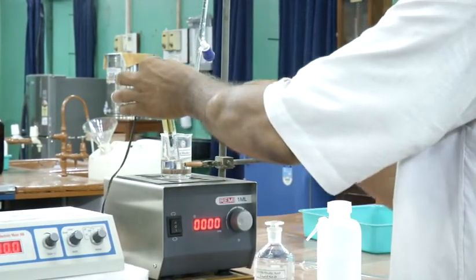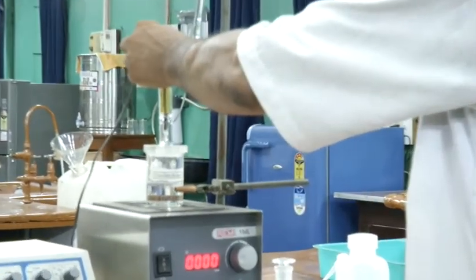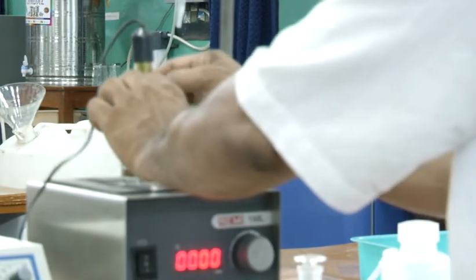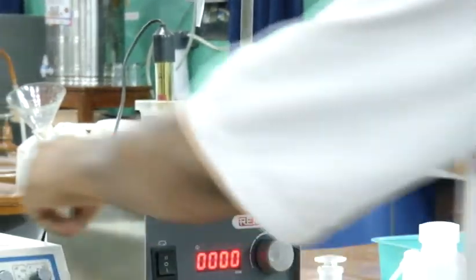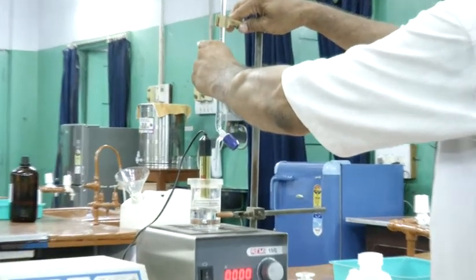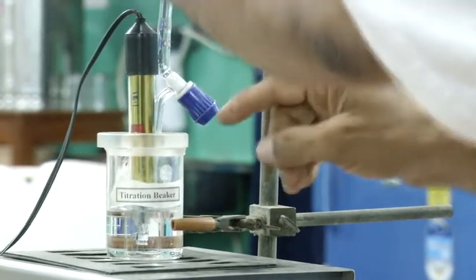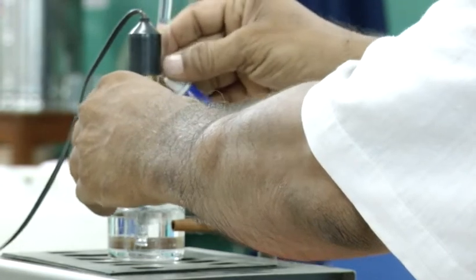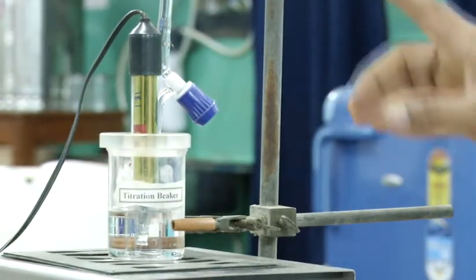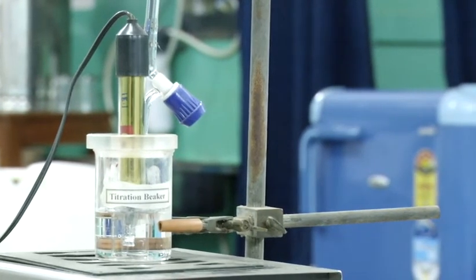Before you place the cell on the beaker, you have to put this lid on the beaker. This is the lid of the beaker. Then through the big hole, you have to insert the cell in this way. Then you have to insert the tip of the burette. You will find a small hole on the lid. Through that hole, you have to insert the tip of the burette. You have to insert it in such a way that the tip should not touch the solution at the bottom. It should be well above the solution, like this. Okay.